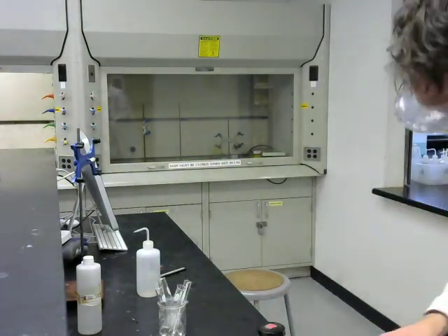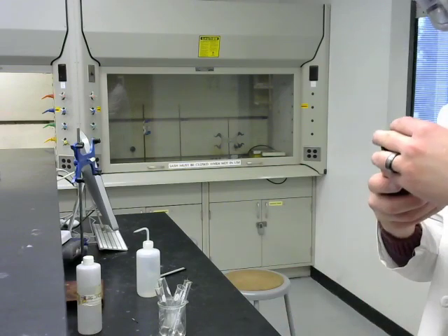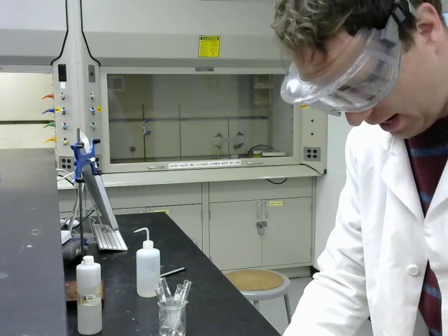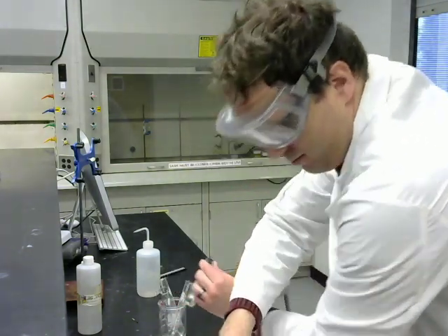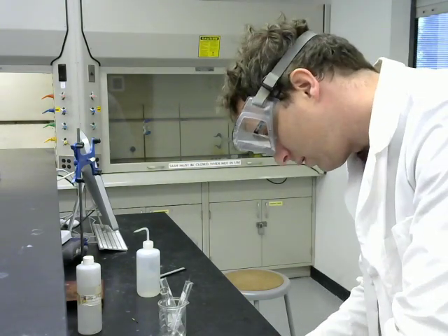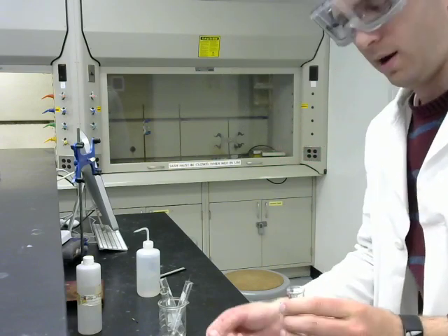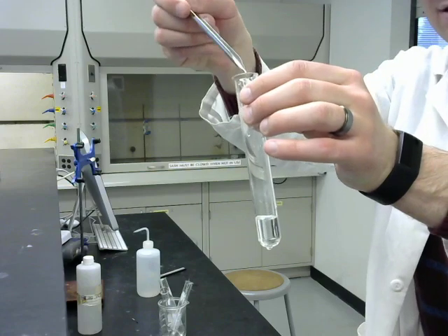Next we're going to do iron. Where's my iron? Here we have a fine powder of iron. Tilt that a little bit. Okay. So here is iron in acid.